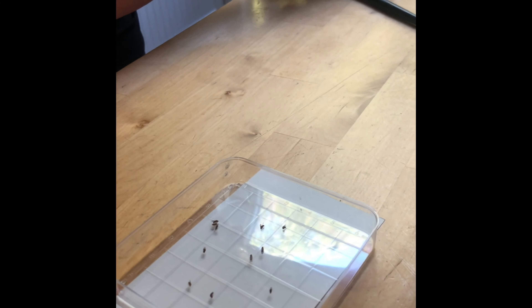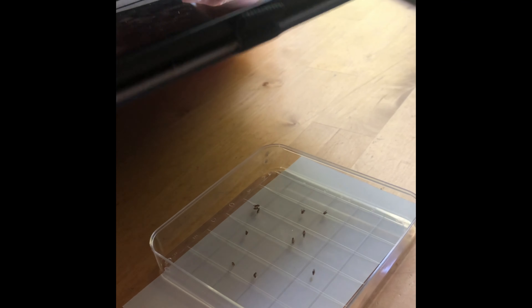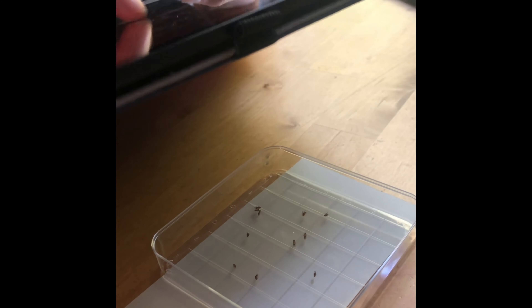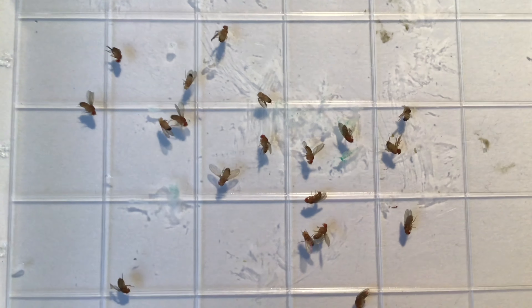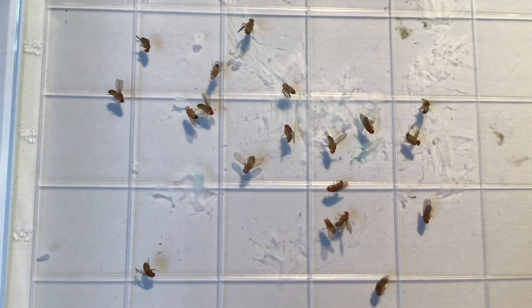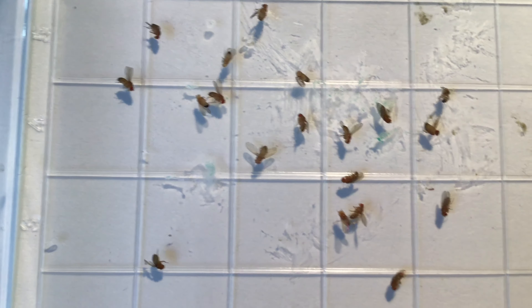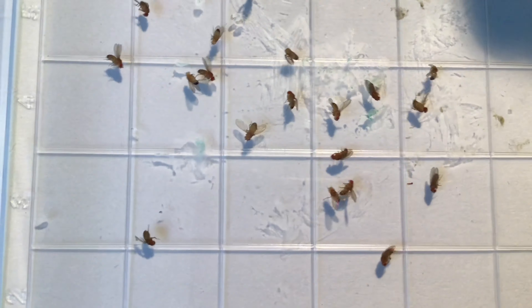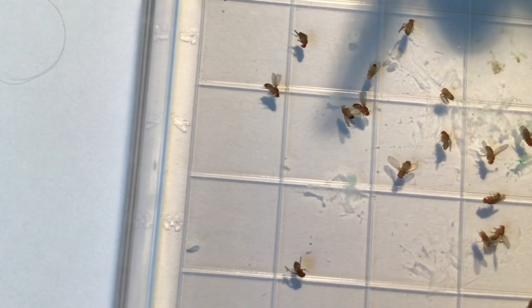To do that, I'm going to try the camera on my iPad and see if I can take a really large photograph. Hello students — it's fly genetics time in my kitchen! Due to the global pandemic, I am trying to phenotype the progeny of a fruit fly cross here on my kitchen table using my iPad. To manipulate them I have a paintbrush — I thought about using an eyeshadow brush.